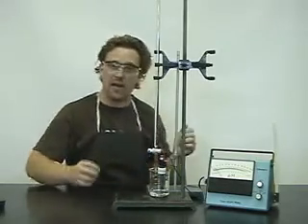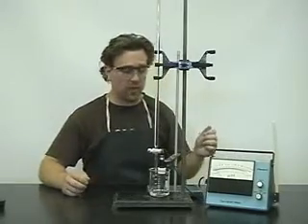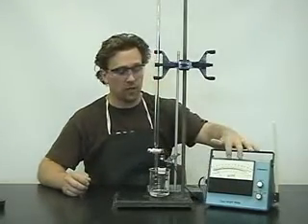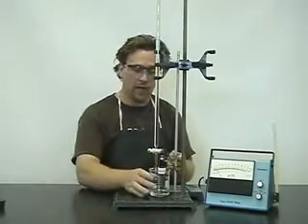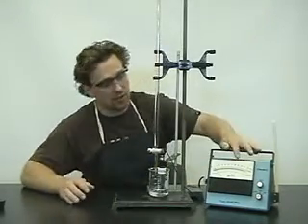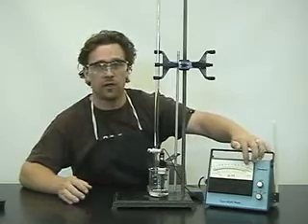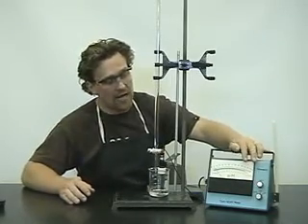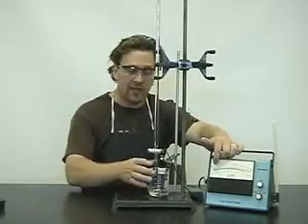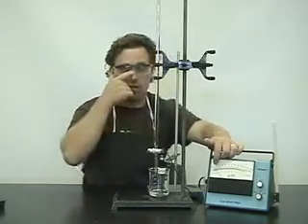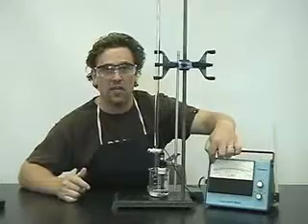Now, to do this titration and measure the pHs, we're going to use a pH meter. What we've done is we've set up a pH probe, and it's connected to a meter here. Now what I'll do is I'll do a little close-up, and notice the starting pH, when zero mils of sodium hydroxide are added, is a pH of one.